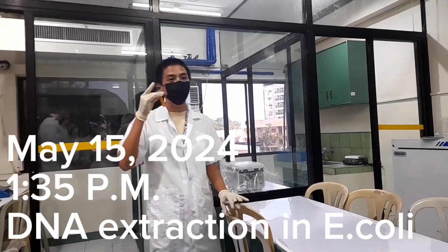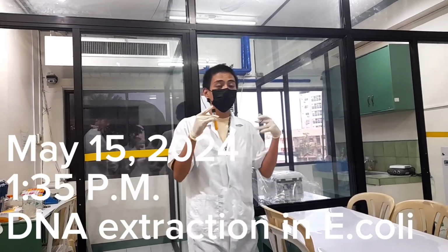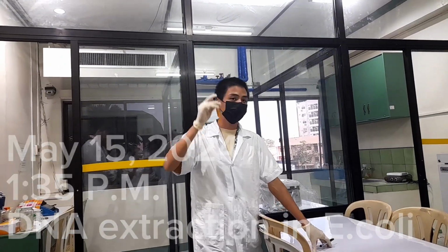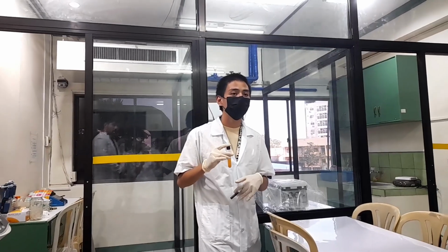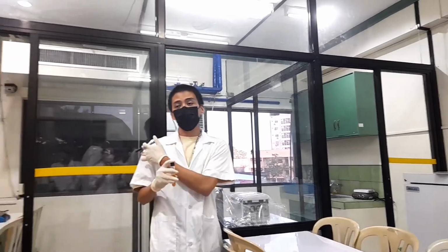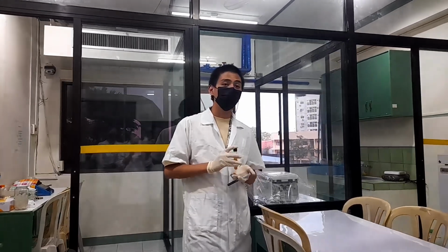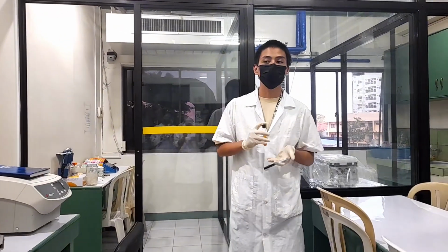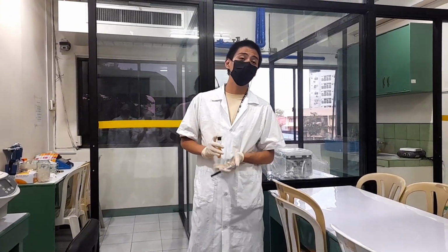Cloudy, or turbidity. Turbidity means the cells absorb light, and this turbidity means that it has growth. So OD600 tells us if there's light absorbed by the machine. Obviously the media has growth. So basically that's how it determines whether the bacteria has grown.